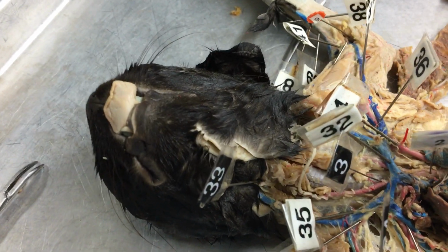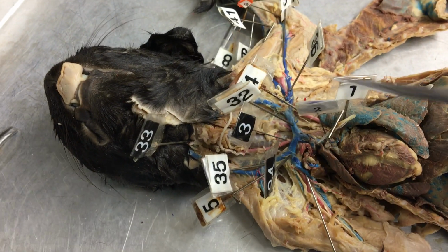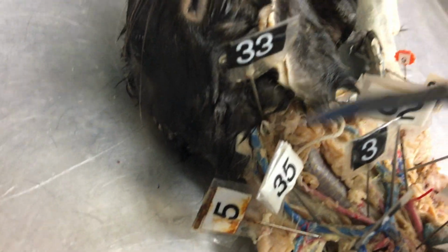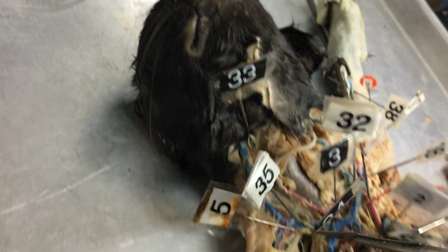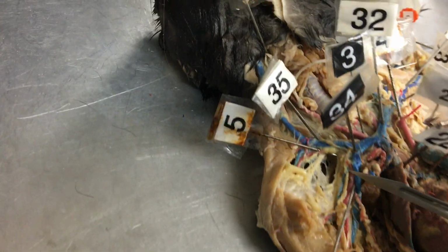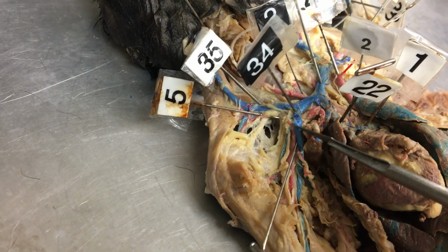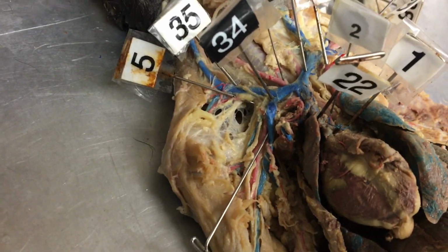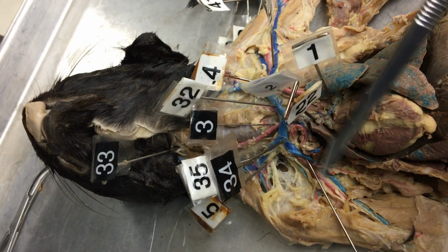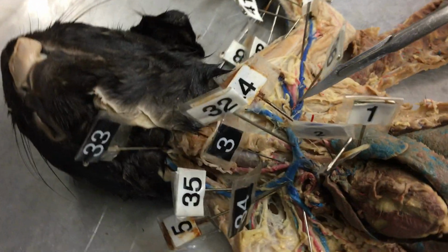32 is brachiocephalic. That's the left brachiocephalic vein. And then continuing on up this way, 33 is the internal jugular, and 34 is the external jugular. Oh no, 35 is the external jugular. Sorry, where's our 35? There it is. 35 is external jugular. 34 is subclavian, and it's just a short little branch. Jugular is going up cranially from the subclavian, and subclavian is heading out past the ribs, where it's going to become the axillary. That's number 36.